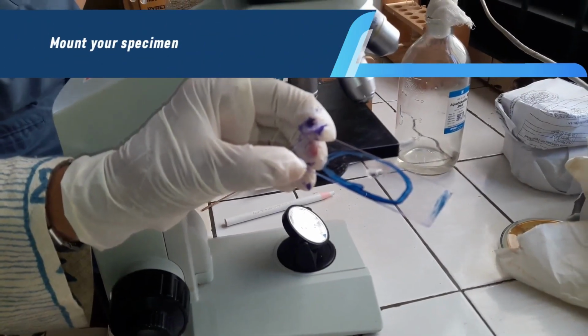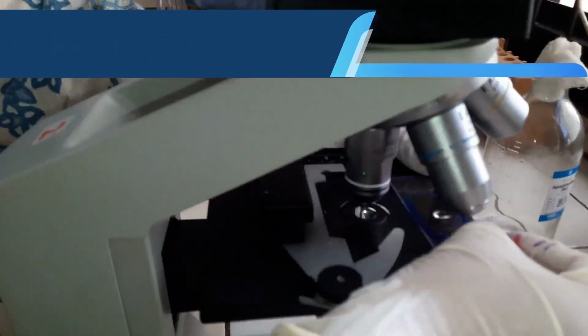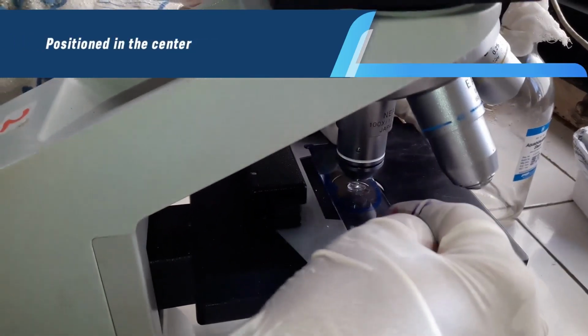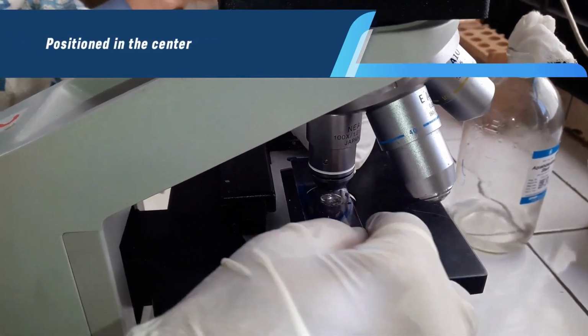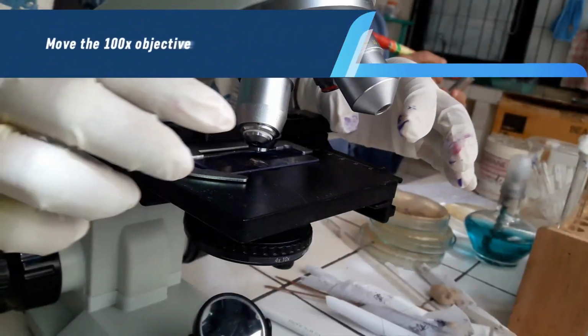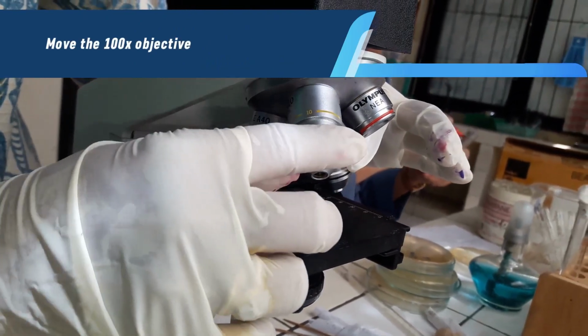Mount your specimen onto the stage. Use the metal clips to keep your slide in place. Make sure the specimen is positioned in the center, right under the objective lens. Gently move the 100x objective into the oil, without disturbing the slide.